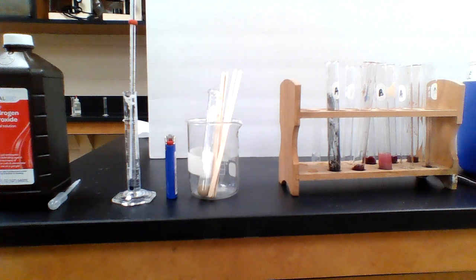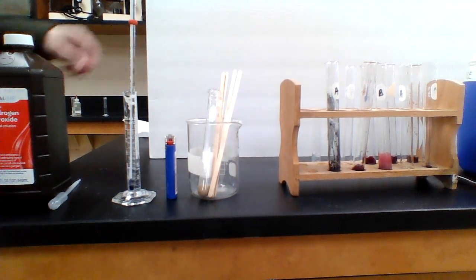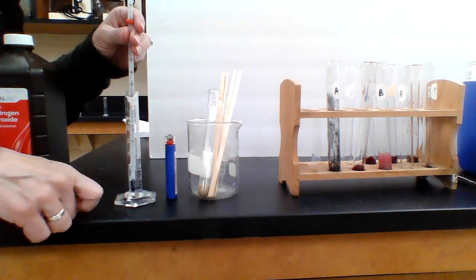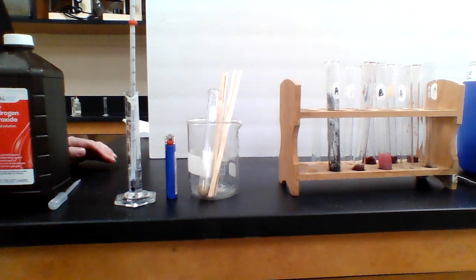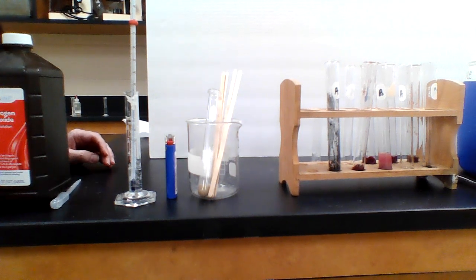All right, I'm back. I washed off my thermometer, and I'm going to try something that I should have done in the first place. I put the thermometer into a test tube that has hydrogen peroxide in it, just so that we could get a starting temperature. Our starting temperature today will be the same all day long because it's just coming out of this bottle. Whatever starting temperature I record right now will be our starting temperature for everything that we do.